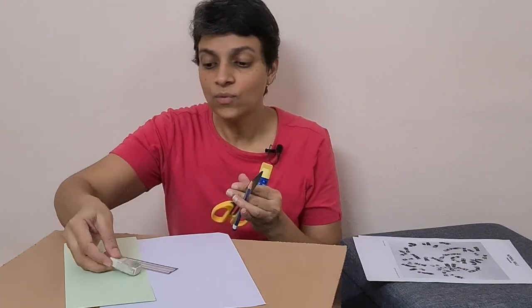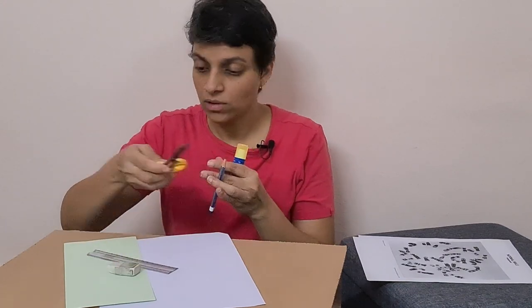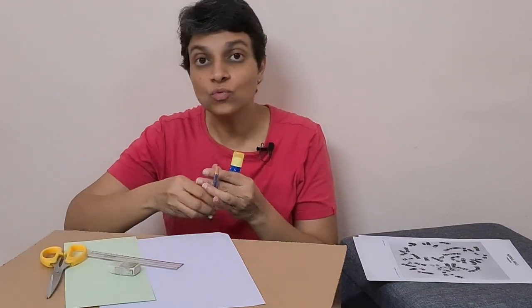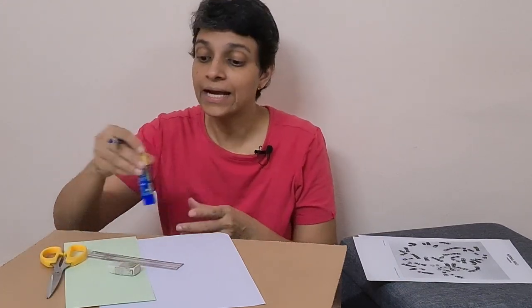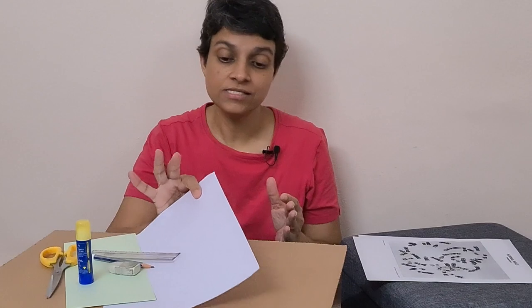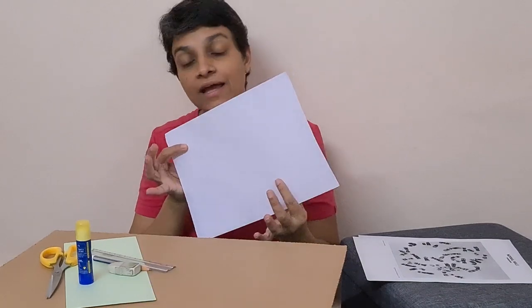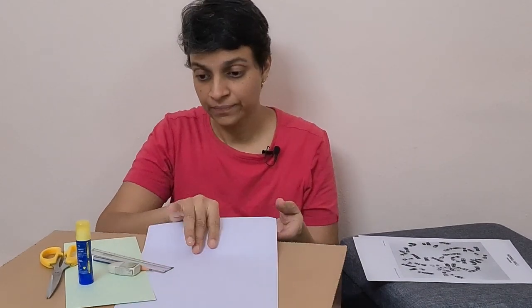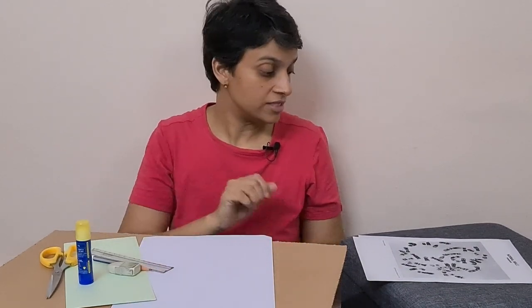Why we require all this is we have to cut and paste and arrange the chromosomes in their descending order of sizes on the A4 size sheet. Therefore, we will be requiring all this.